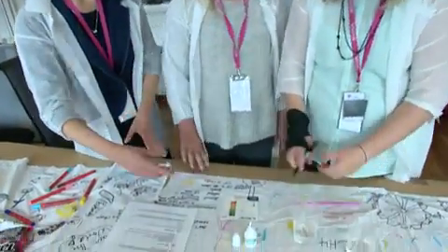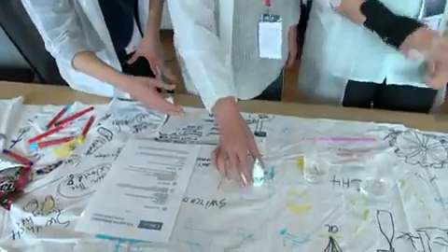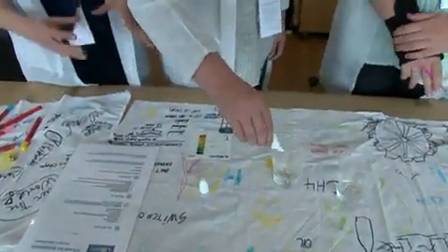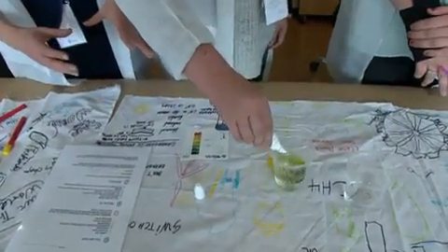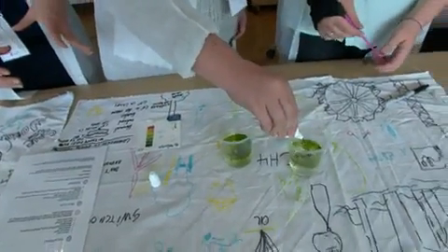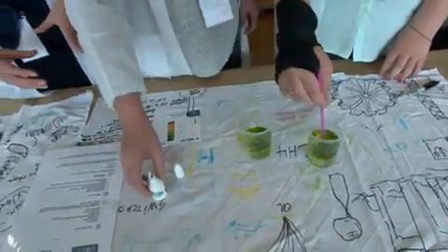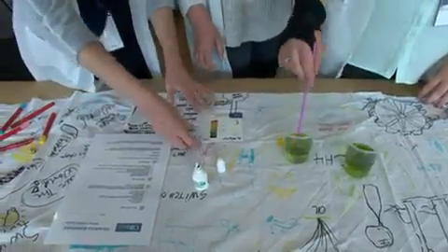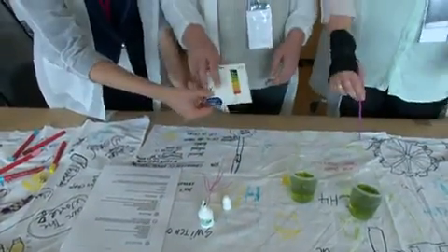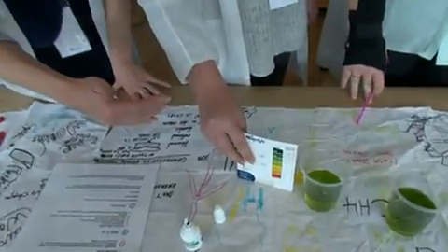Yvonne, if you could add the pH indicator to both the cups of water. The pH indicator just shows you whether something is acid, alkali or neutral. And this shows you the colour and what it represents.